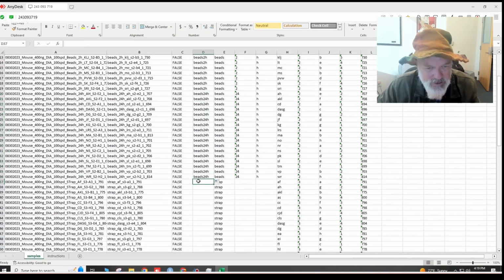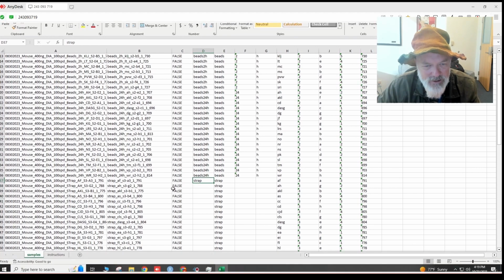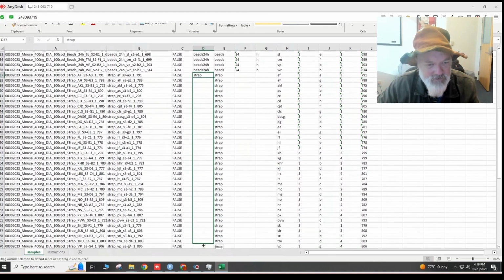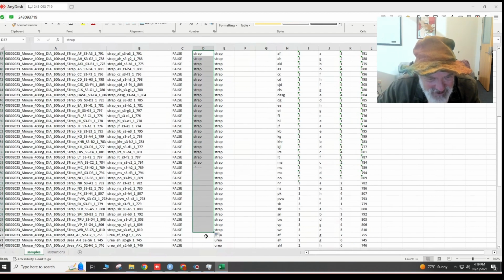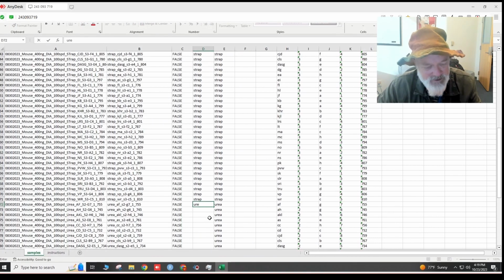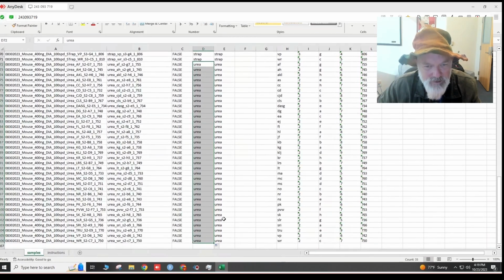Okay, and then this one is S-trap. And the initials are the people that did it. S-trap. You guys can have this data set. Maybe someone will publish it. It would be a nice little paper to see how these behave under 36 different people. Okay, so we got a lot of ureas. Boom.